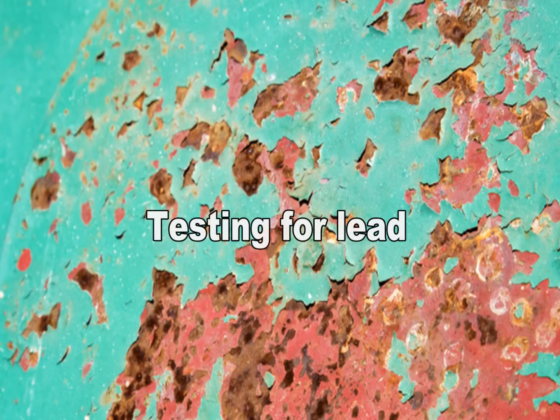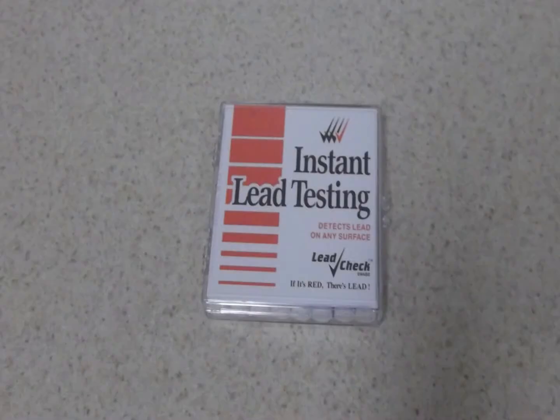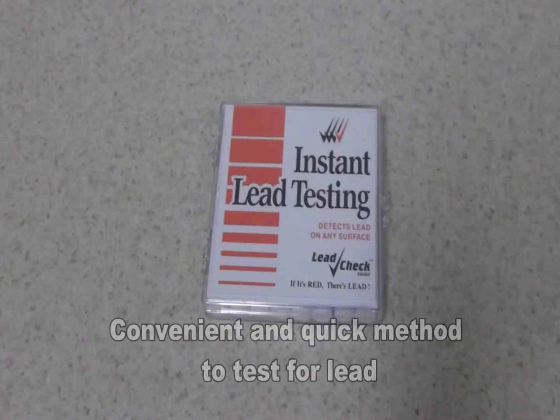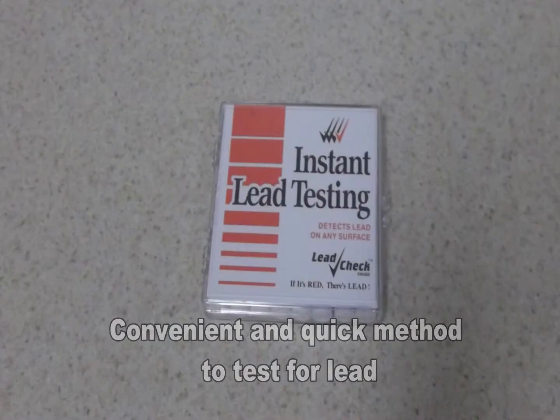One method to test for lead in paint and on surfaces is a lead check swab. Lead check swabs are a convenient, instantaneous test for the determination of the presence of lead.